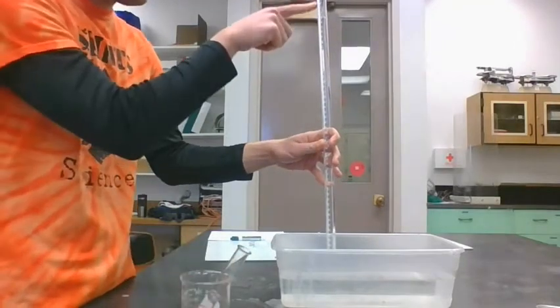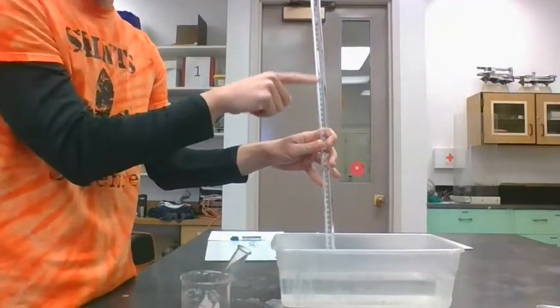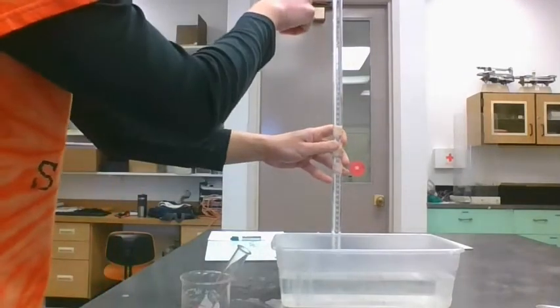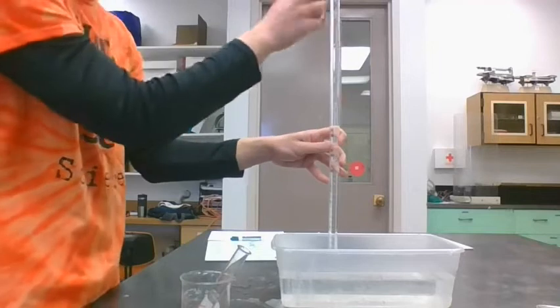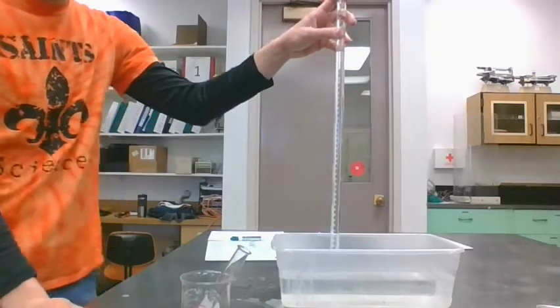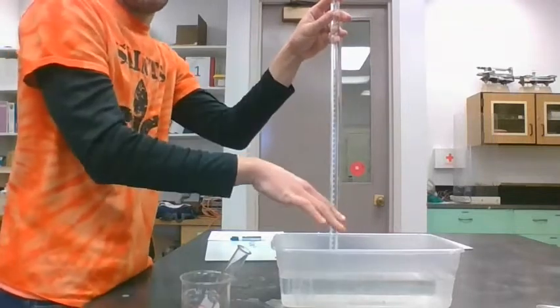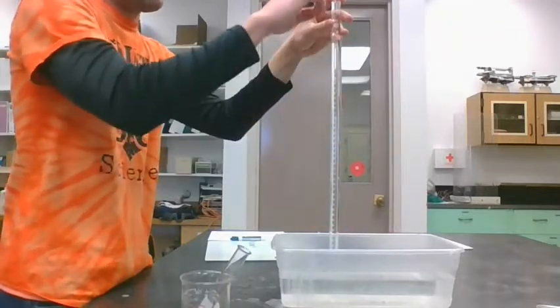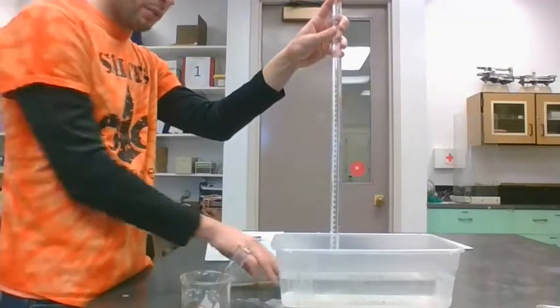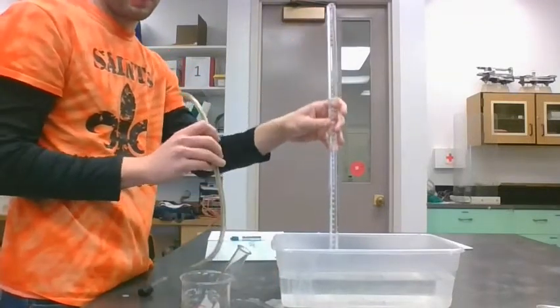Now, it has little marks on it, like a graduated cylinder does. The 0 mark is at the top, and then it goes 2, 4, 6. So gas collects in here, pushes the water out, and then we can read upside down how much gas was in here, in the opposite way we would read a graduated cylinder.